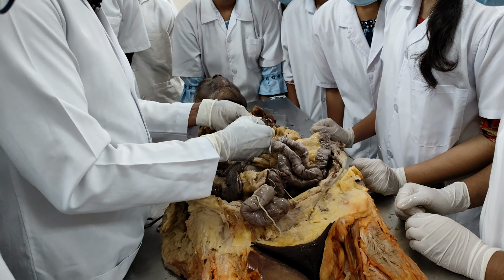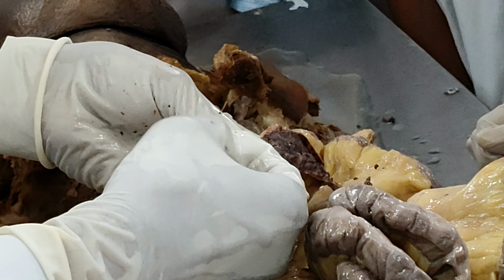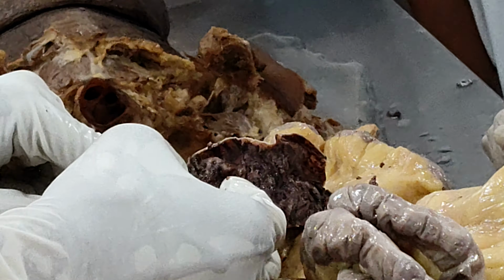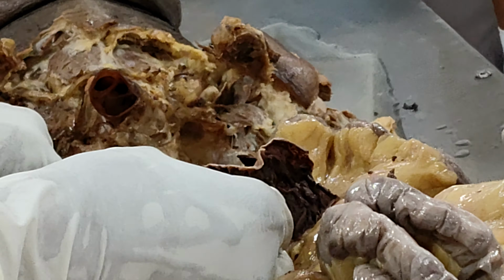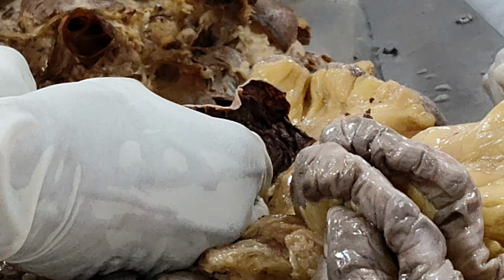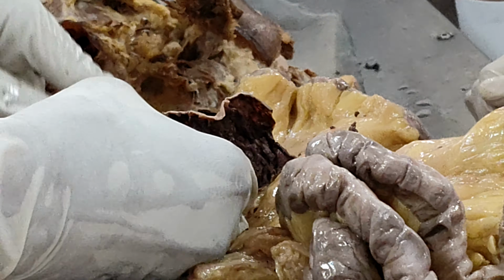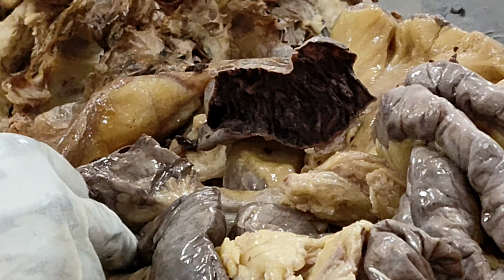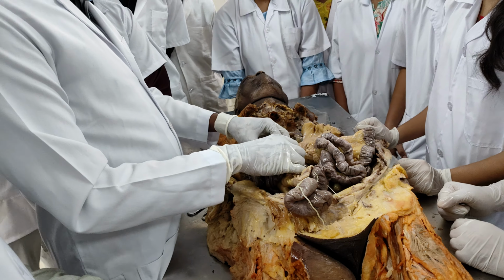Here, microscopically, you will be seeing nice small patches. In the submucosa of the ileum, you will be seeing microscopic patches which are nothing but the lymphatic aggregations called the Peyer's patches. The Peyer's patches are seen in case of ileum while they are absent in case of the jejunum, right? These are all the differences between the ileum and the jejunum.